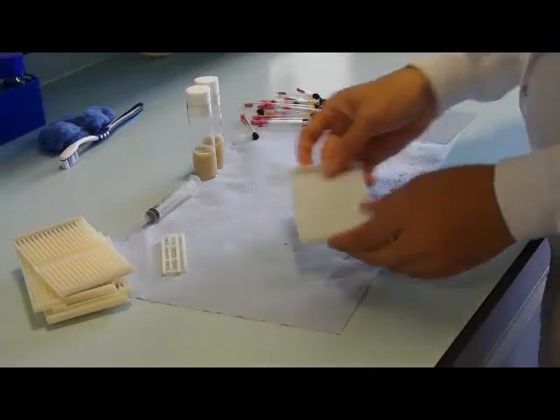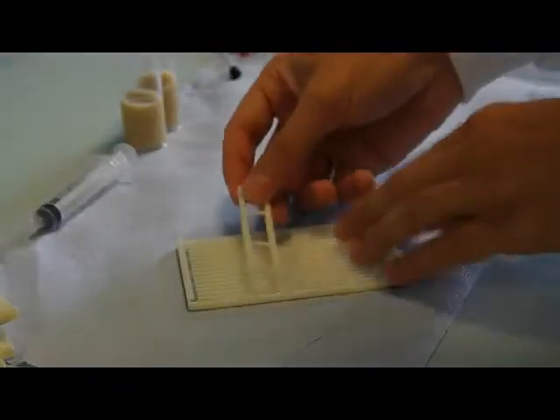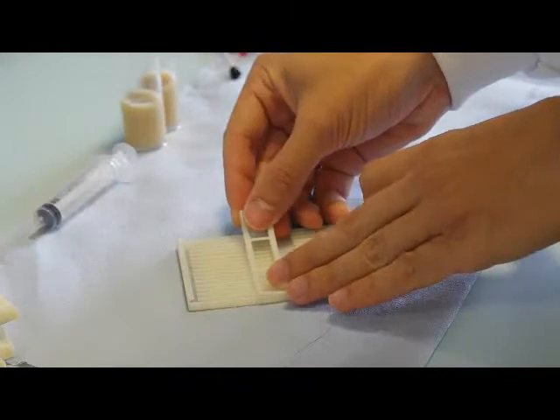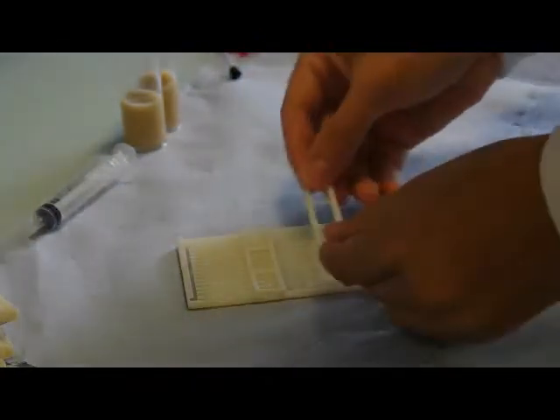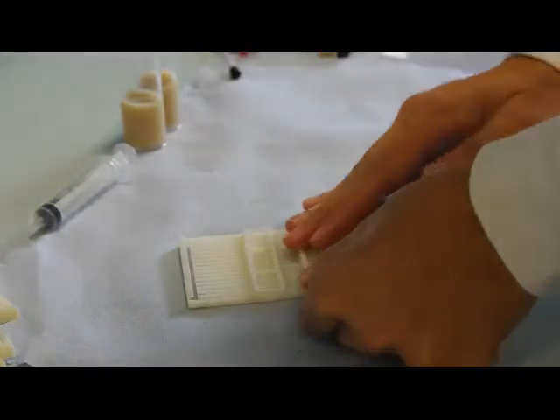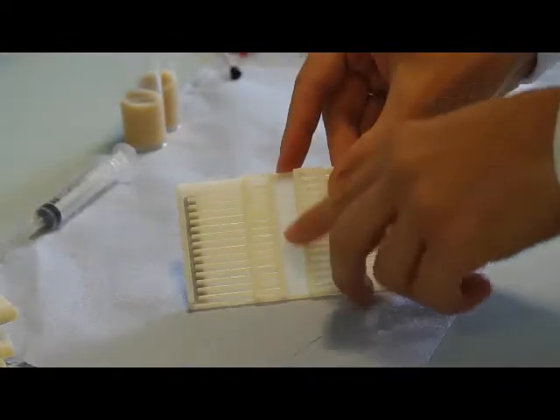Here we are starting with a clean arena, and the first thing we need to do is pour some fly food inside the central channel. To contain the food from spilling into the grooves, we place two removable walls, one on each side of the channel. The food will go in here.